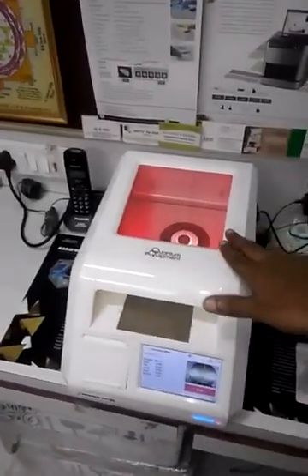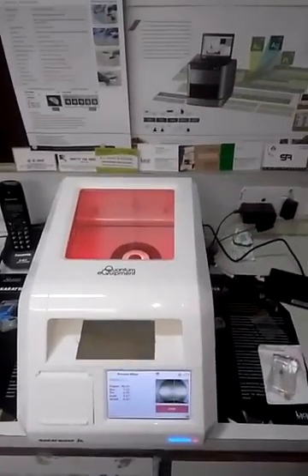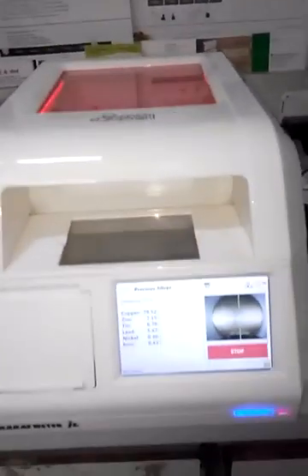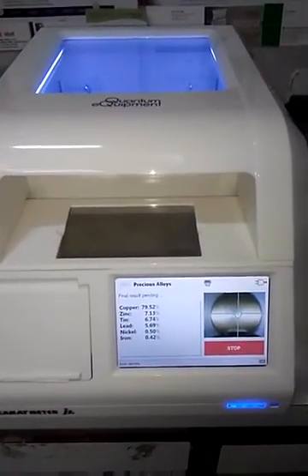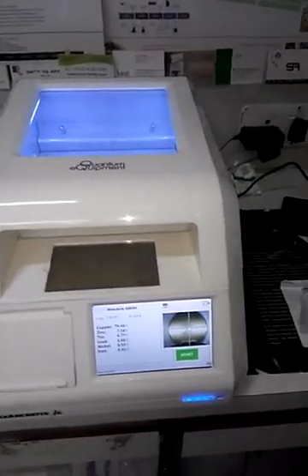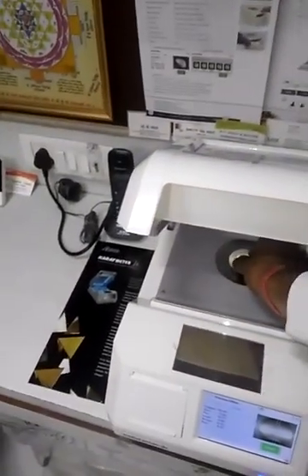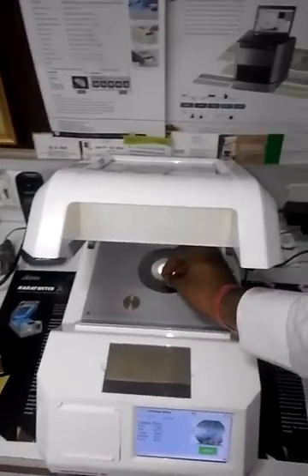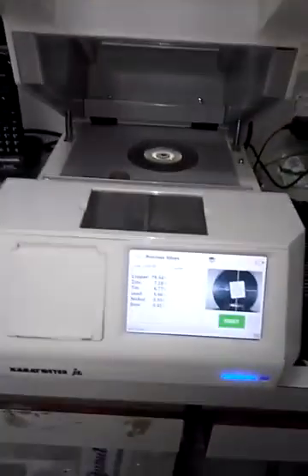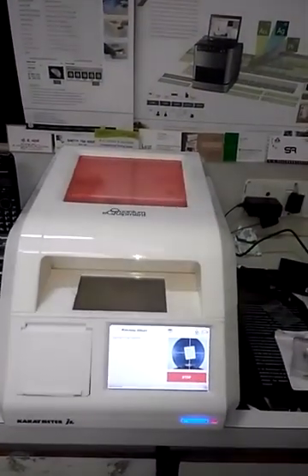You can see a red light — red light means work in progress. When it turns blue, we can say the job has been done. Results are coming on the screen. One voice message will come out: 'Done.' It means yes, the reference has been done. Now you can check any standard sample — the machine is ready. I'm putting one sample in — do the same job.